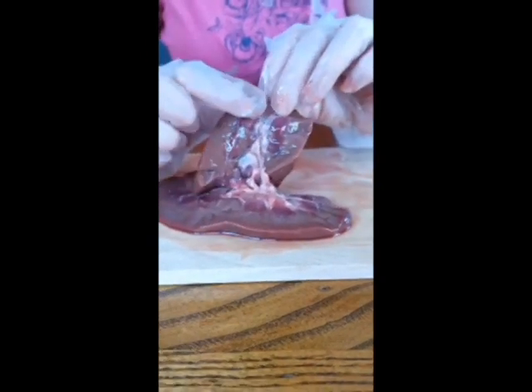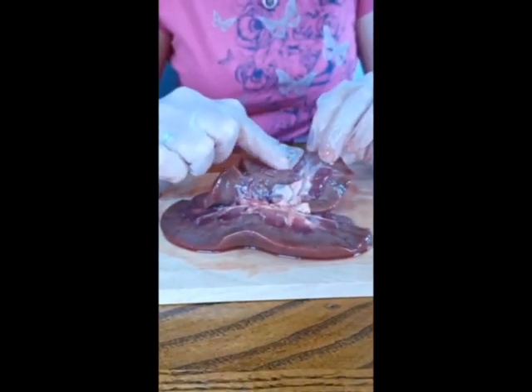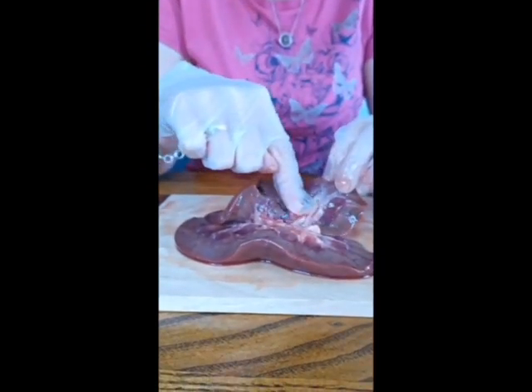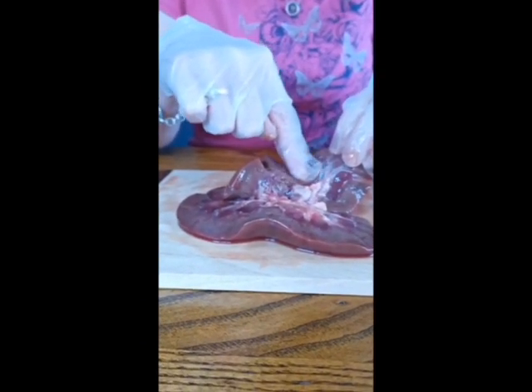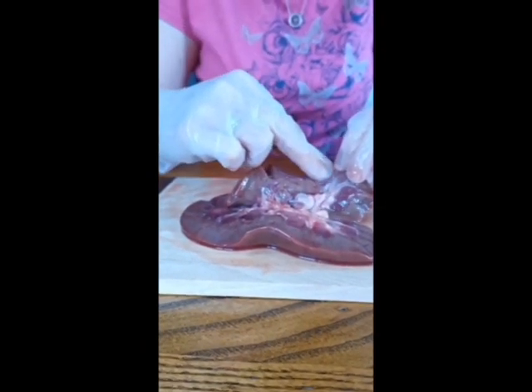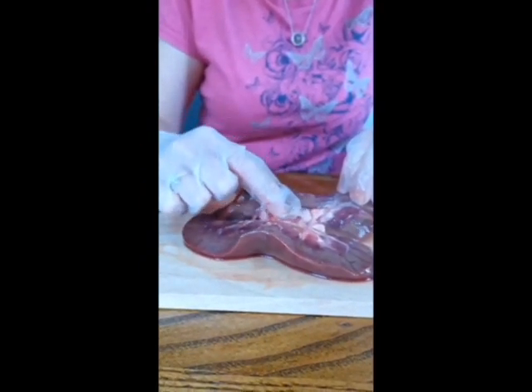This next layer is a bit of a pinker kind of layer. Do you see the pinker layer compared to the greyer bit? And that has what's called a loop of Henle. So the filtrate, the plasma, goes down into the loop of Henle, and this is where a lot of chemicals swap places basically, and the kidney is filtering the blood and cleaning it. All right, it then comes back up here and then it feeds down through tubes into this whitish bit, which is called the renal pelvis.